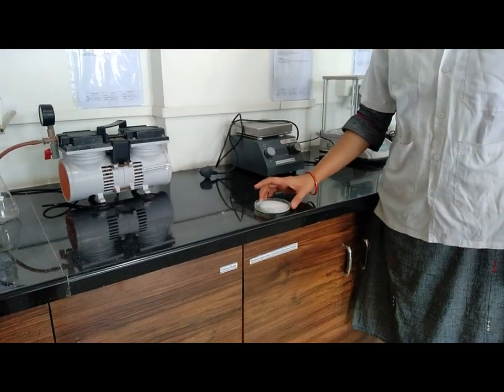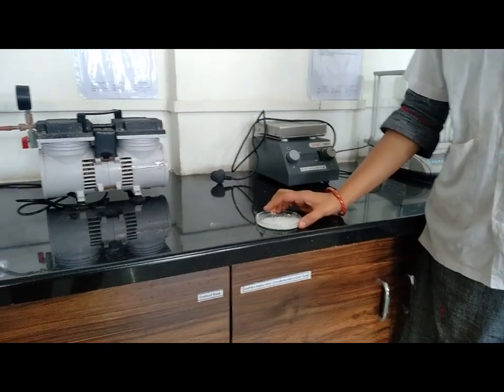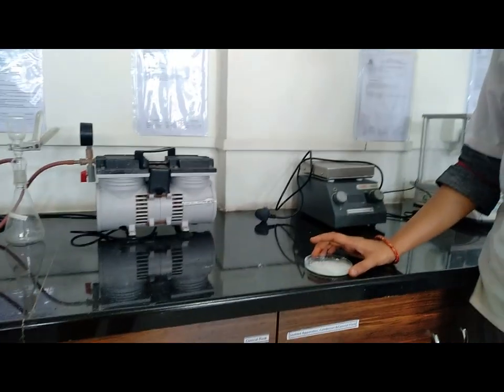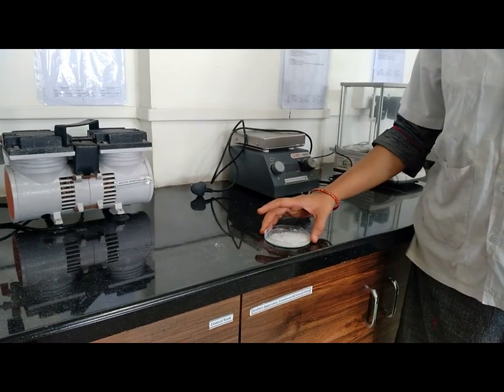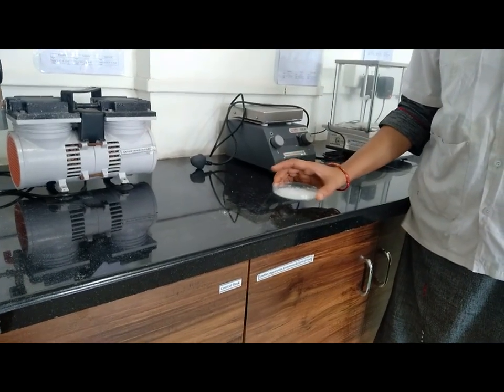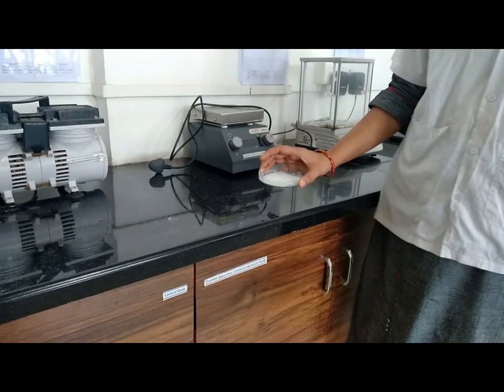After drying, we got white crystalline product of benzoic acid obtained by recrystallization in boiling water. Now for this solid compound, we have to weigh this powder and then perform the melting point.